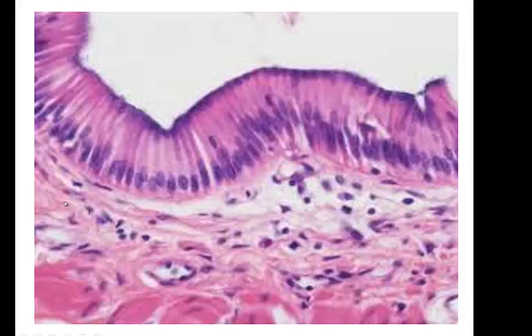Areolar connective tissue. It doesn't look like it when we get to later slides, but all of our epithelial tissue rests on connective tissue, and any connective tissue that opens to the outside of our body, like our respiratory passages and our digestive passages, all of those are called our mucous membranes.